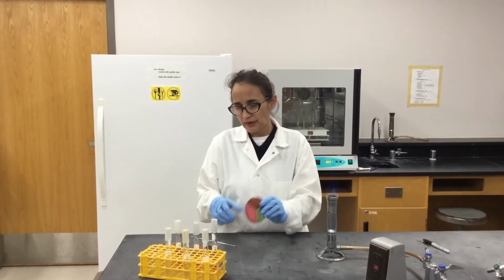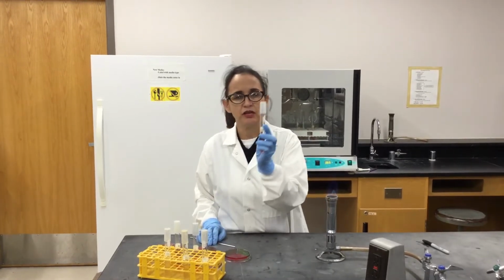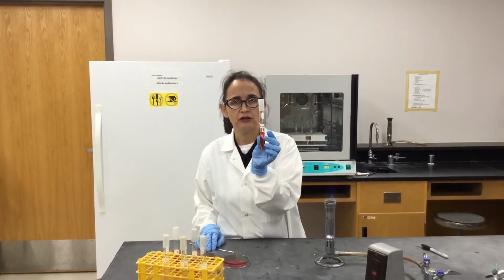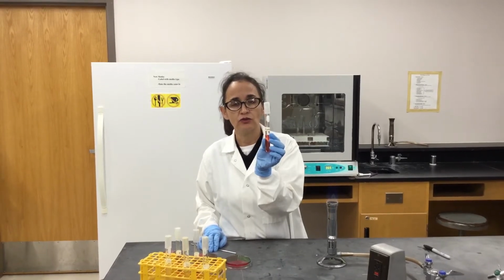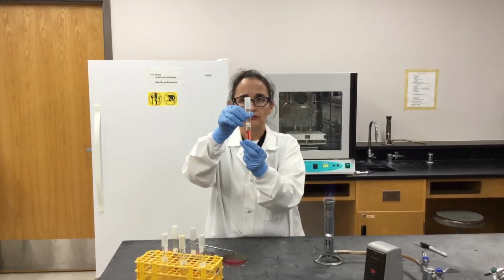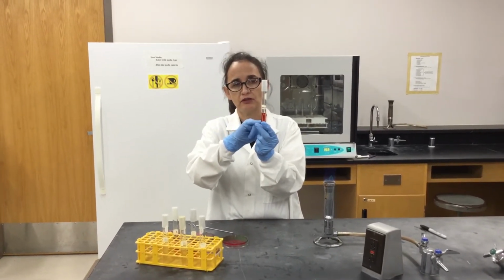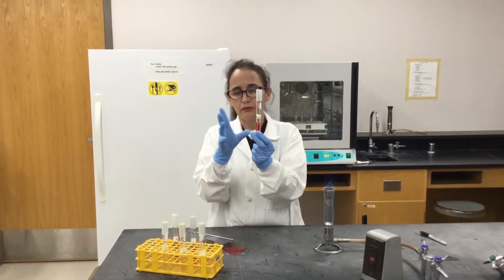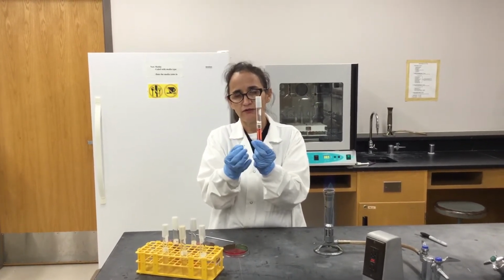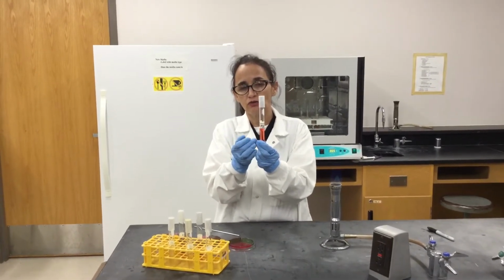So another media that we're going to inoculate today is broth, and this is called phenol red broth, which is enriched with glucose. And inside this broth we have a little mini test tube that we call the Durham tube or Durham chamber. So within this media at least we have a source of energy for the bacteria, which is a carbohydrate, and in this case it will be glucose.